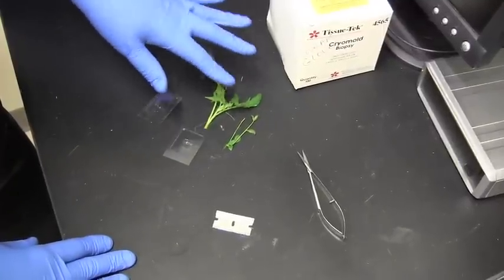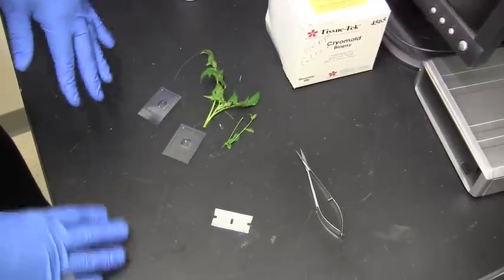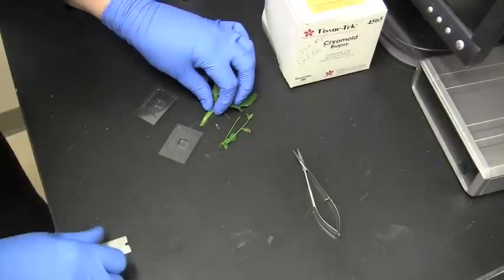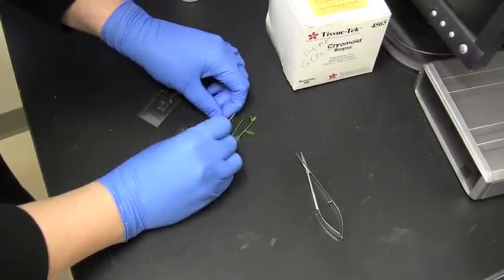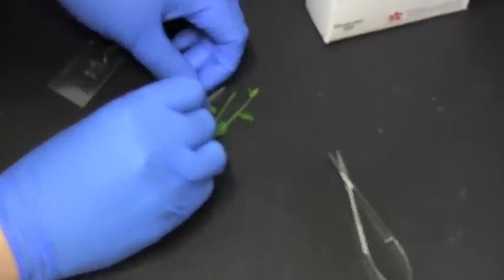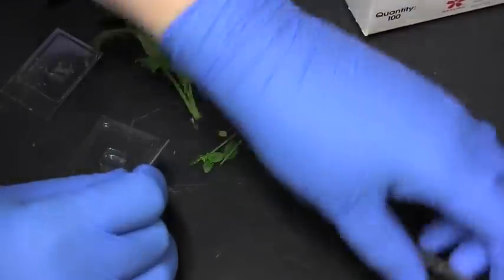The tissue here is tomato and arabidopsis stems. Either will work, and you can either cut them with a razor blade to the size that you want, or you can use scissors.